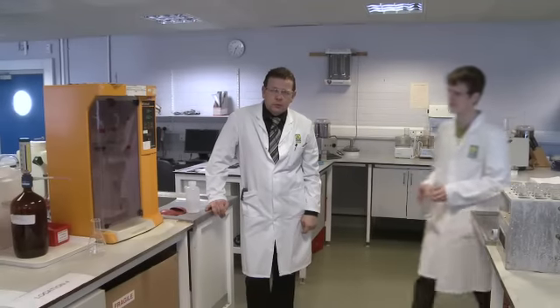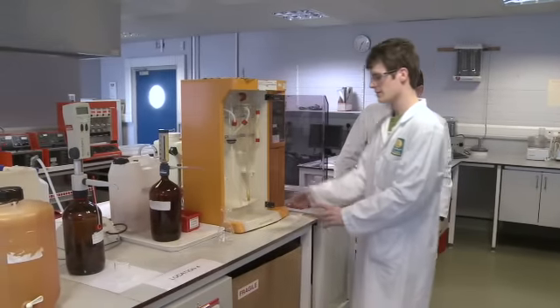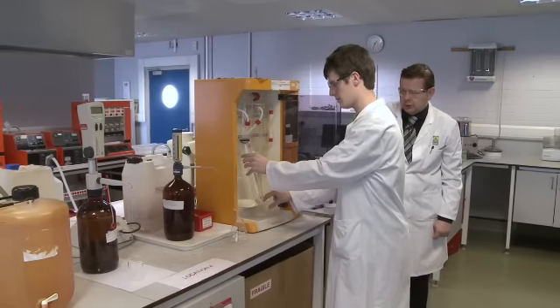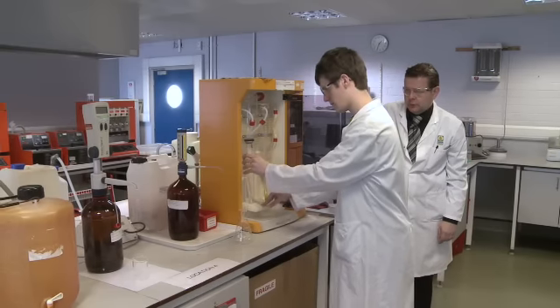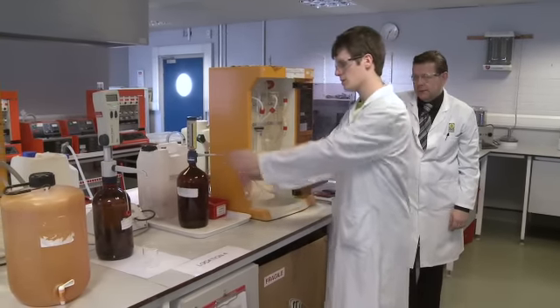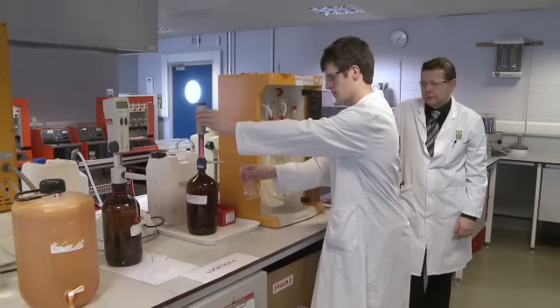After 1 hour, the digestion process is complete and all the protein within the sample has been broken down into its ammonium salts. It will now be placed into the steam distillation units and the ammonium salts, with the aid of steam, distilled over and collected in a solution of boric acid, which is now being dispensed.